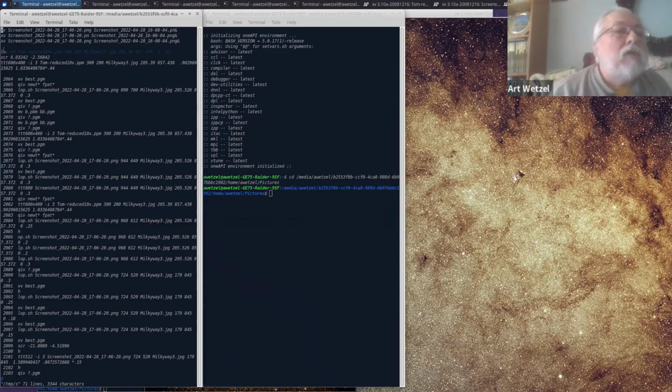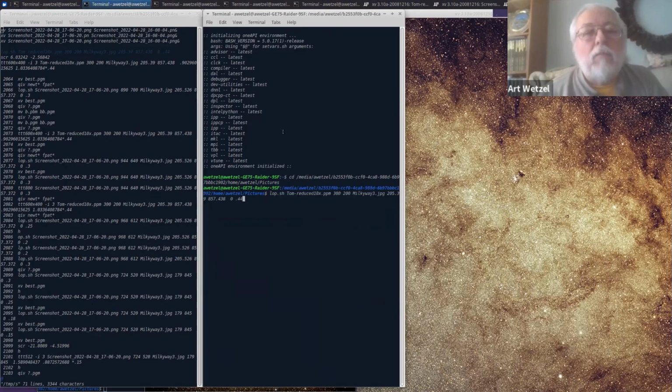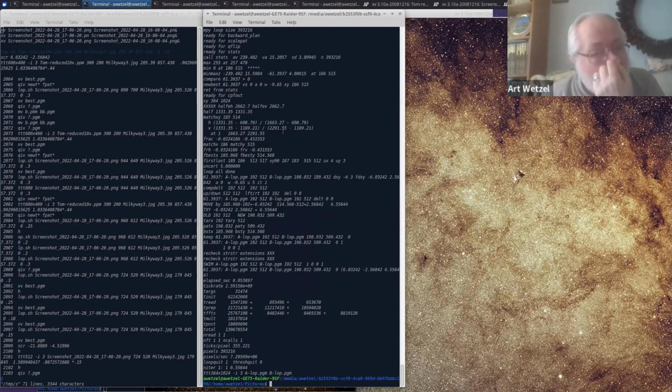So as we've seen in the last 6 months or so, we've had some image sets that are not quite ideal. Whereas the original set of tools that were developed that you've used more or less require really good quality images that have certain pre-constraints in terms of rotation and scale in particular that Terry, you mentioned, how do we know what scale to look for here? And there's a chicken and egg problem, certainly, to this. So what I just did was ran a log polar match that requires some fairly precise positioning ahead of time, and I'll show you here what I mean.